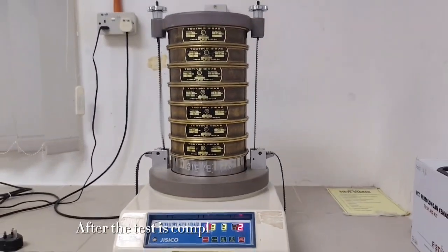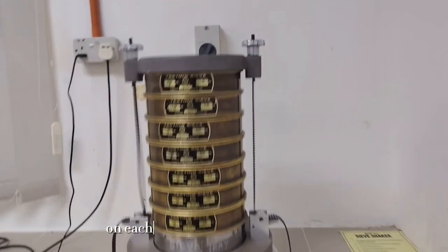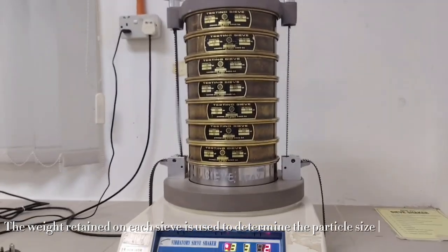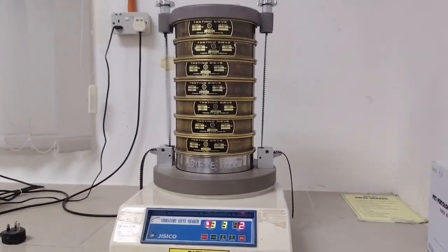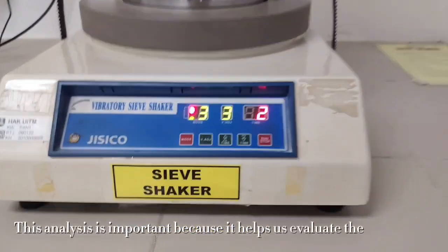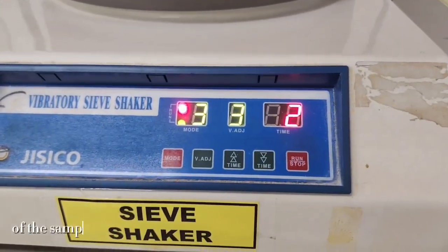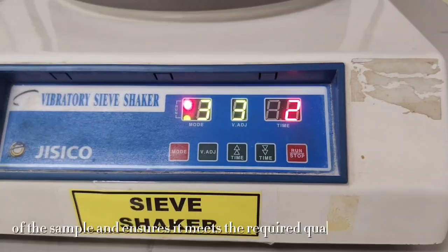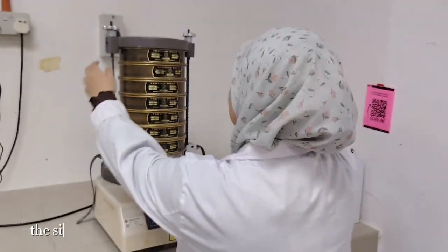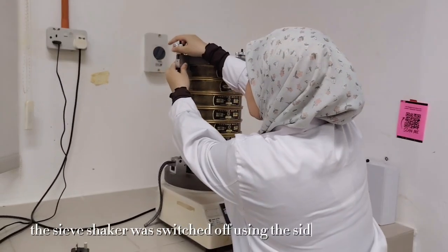After the test is completed, the material retained on each sieve is collected and weighed. The weight retained on each sieve is used to determine the particle size distribution. This analysis is important because it helps us evaluate the uniformity of the sample and ensures it meets the required quality specification. After the sieving process was completed, the sieve shaker was switched off using the side power button.